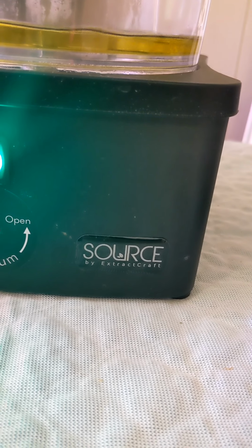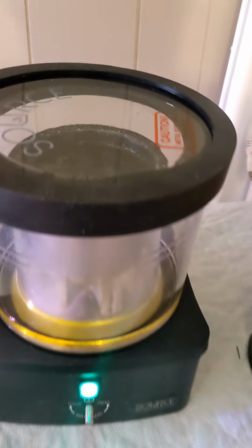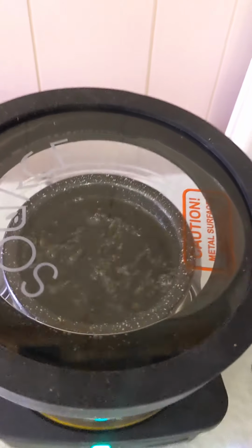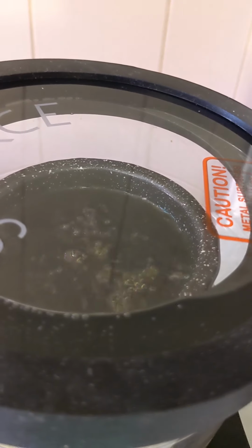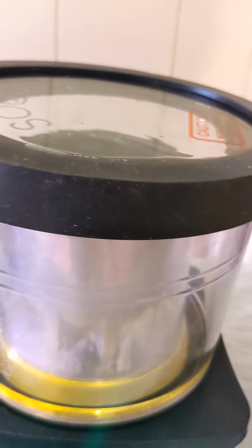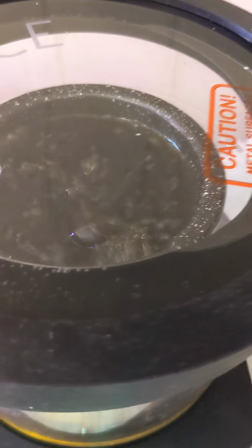Right, here we have the Source Turbo from Extractcraft. What this machine does is there's a crucible in there made of ceramic, and you put your liquid in there that you've made a tincture with, and it creates a vacuum and heats the crucible at the same time. The liquid evaporates and hits the top and the sides, the vapor, and then it falls down and back into a liquid here, eventually leaving the extract in the crucible.